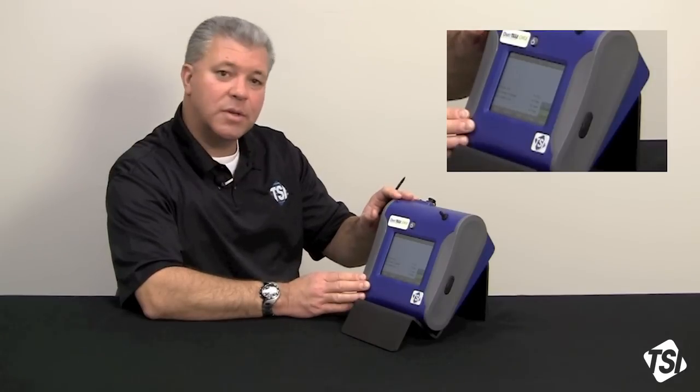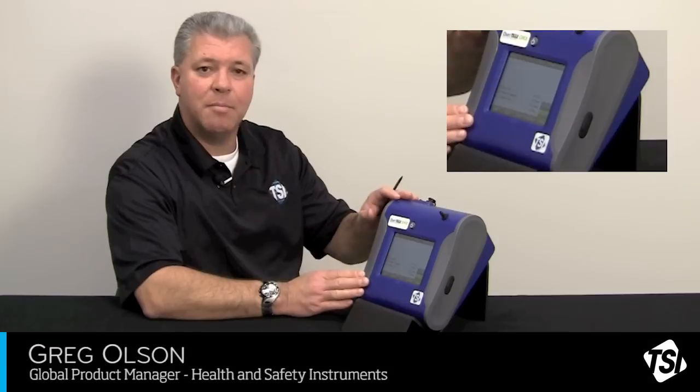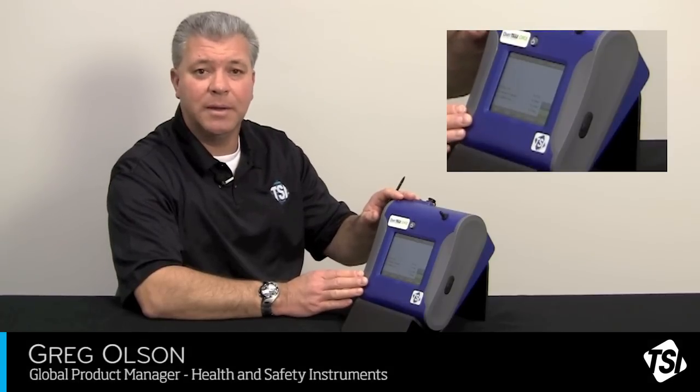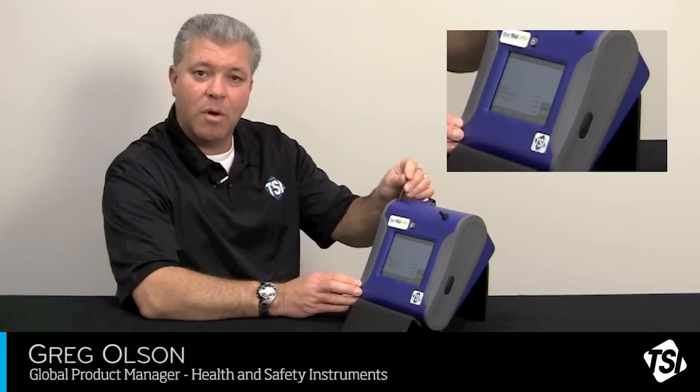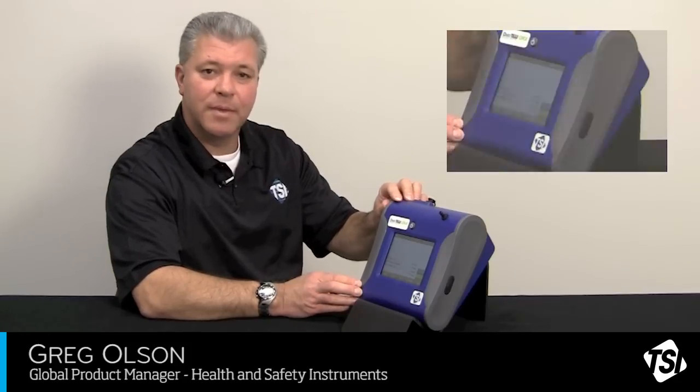So, the DustTrak 2 and the DRX have a very complex programming capability, able to take care of your short-term or long-term sampling needs. This is Greg Olson with TSI. I hope this product training video has been informational. Thank you. Bye for now.